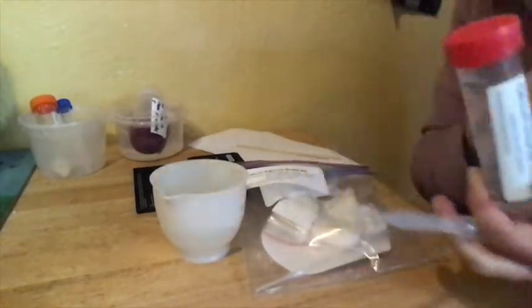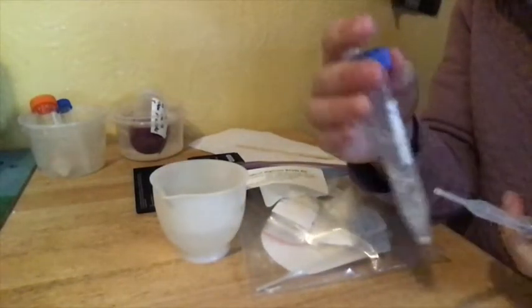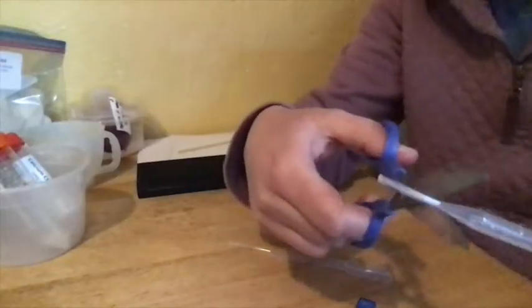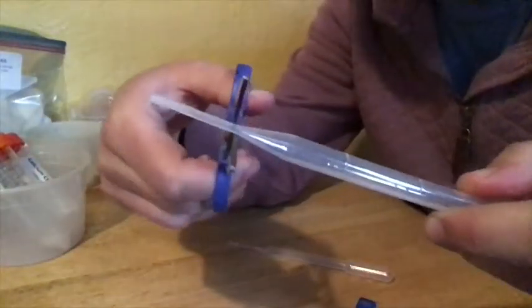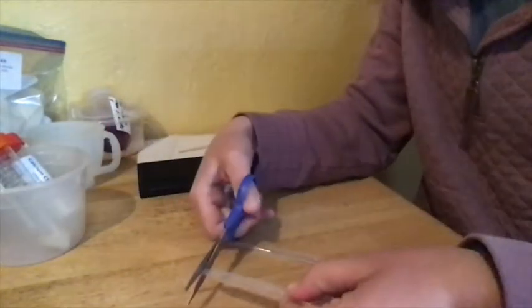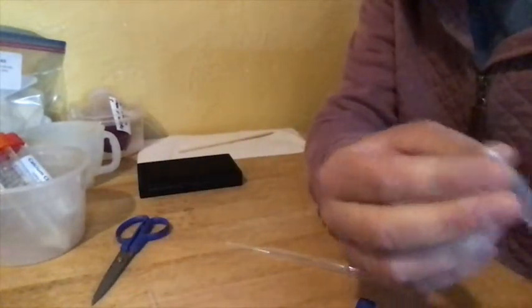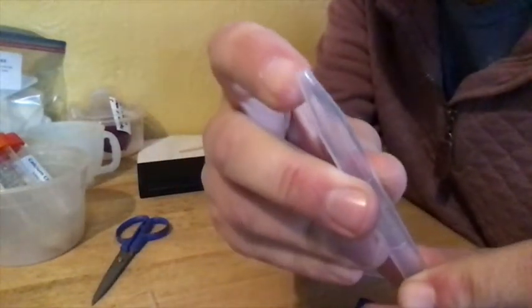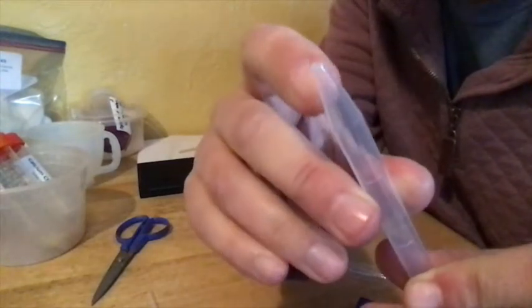Now, it's possible you're going to have to trim off the end of this, because the sodium alginate can be kind of thick, and it can get stuck in the tip here. You just want to cut sort of right here, a little bit above where it starts to widen out. Cut off that tip with some scissors. Make sure you throw this out. If you end up needing to cut a little higher, that's fine too, to open this up just a little bit. You don't want to come all the way up here. You still want a bit of the cone.